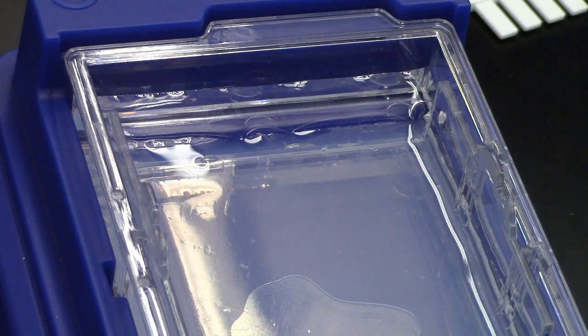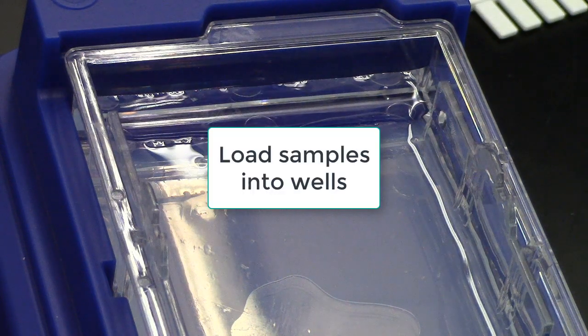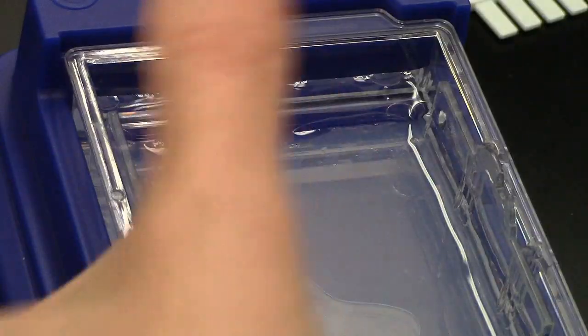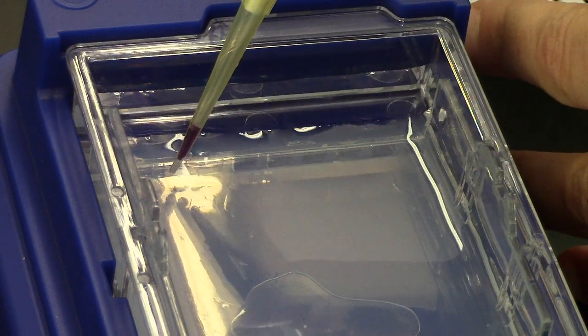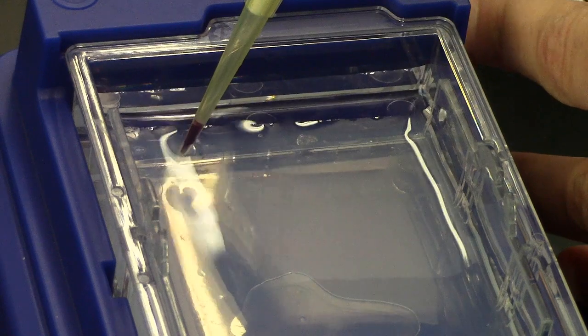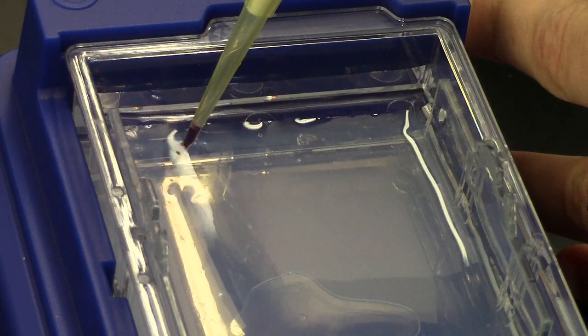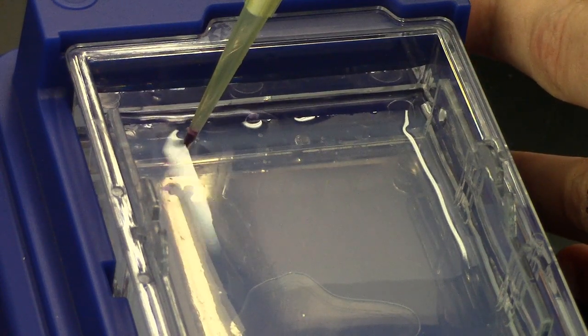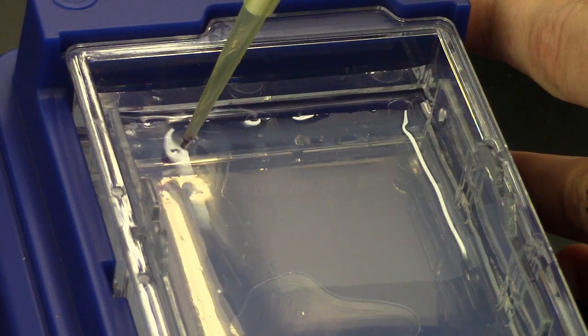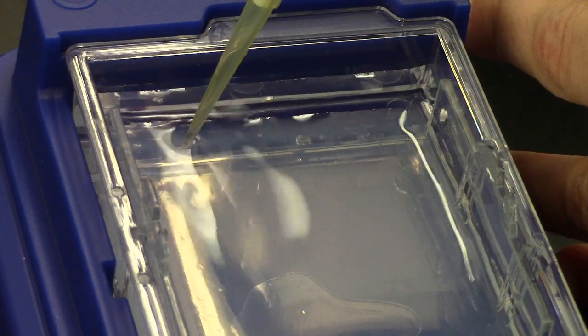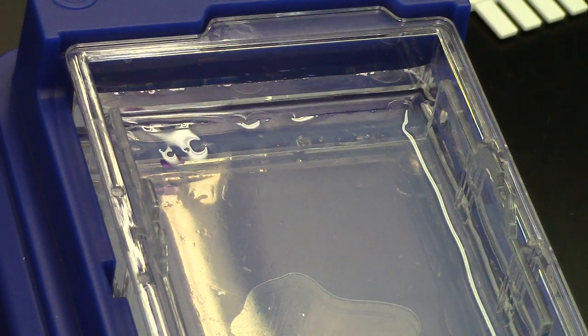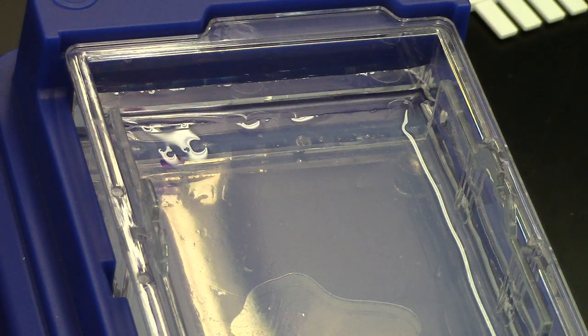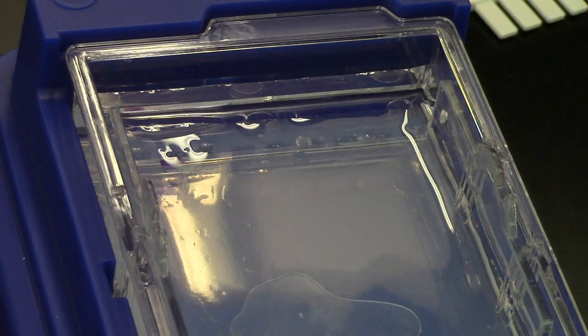You'll be loading each of your samples along with the DNA ladder into each one of the wells by placing your pipette tip above the well and slowly releasing and removing your pipette tip. Remember to change your pipette tip in between each one.